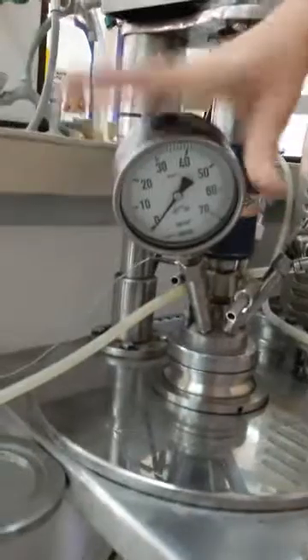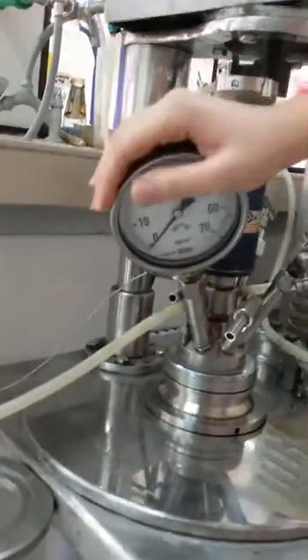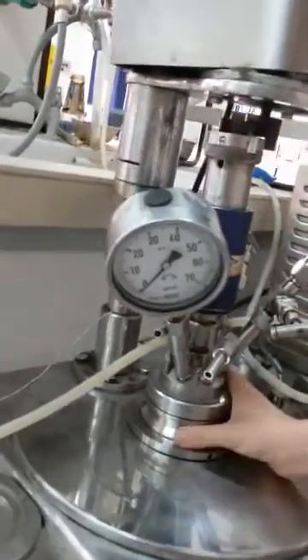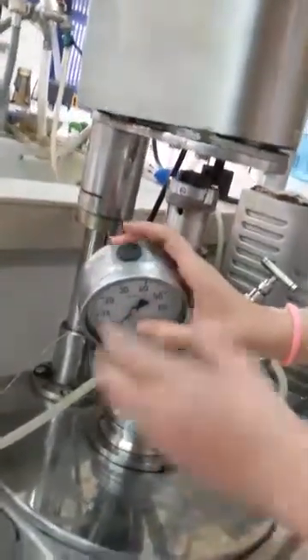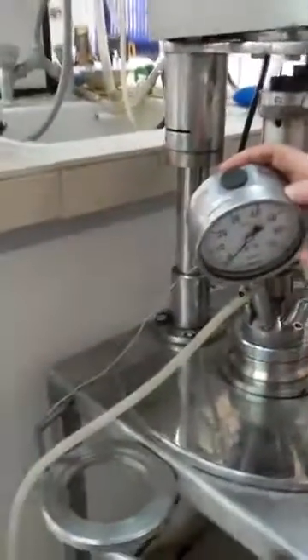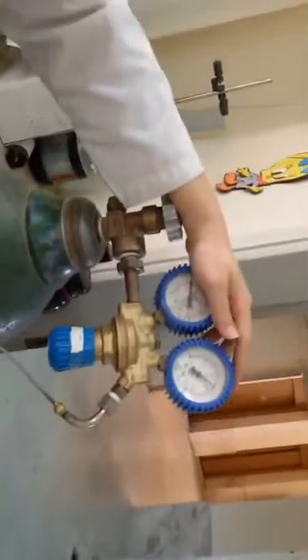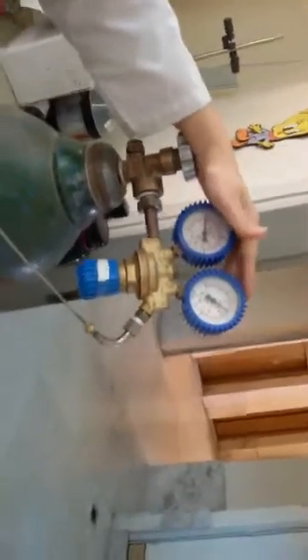I have a pressure gauge which can measure the pressure inside the vessel, and it is connected and has a relation directly with the gas that I'm using. I also have two pressure gauges, which have a relation with the previous gauges.